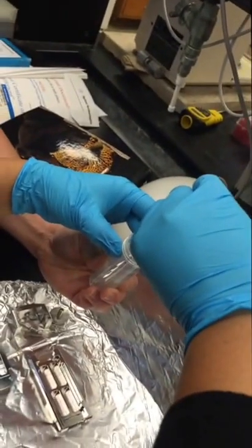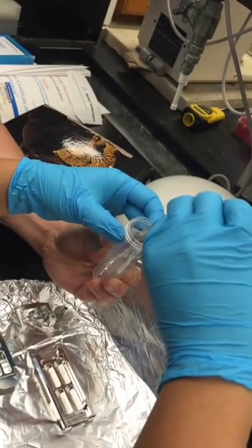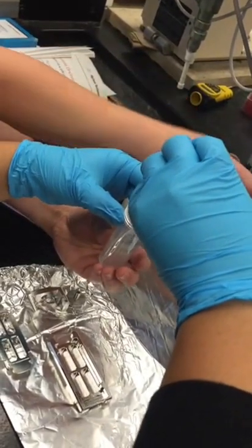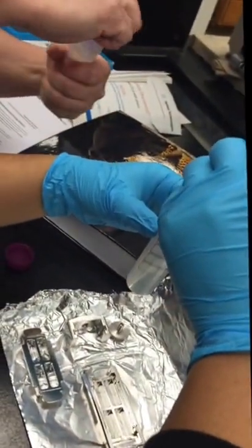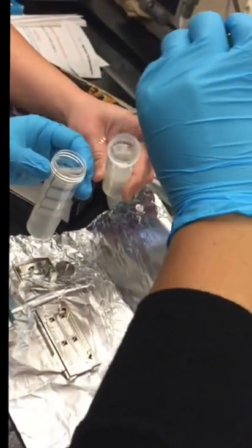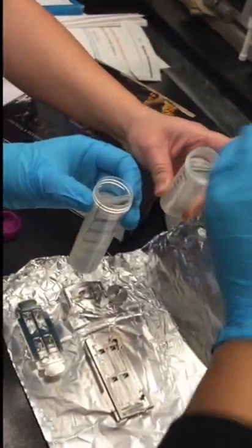If it doesn't go in all the way, that's okay, but see if you can pop it open. Now I'm just going to separate the two. That's perfect. And I can remove the gasket now? Yeah, or you can leave it in there, it's okay. Leave it there, and then we'll put the other one in — the wash one.